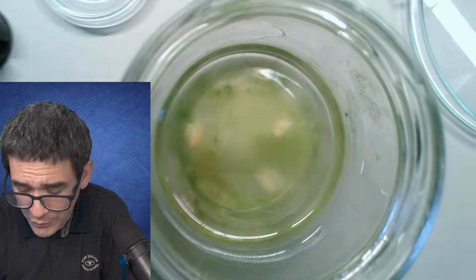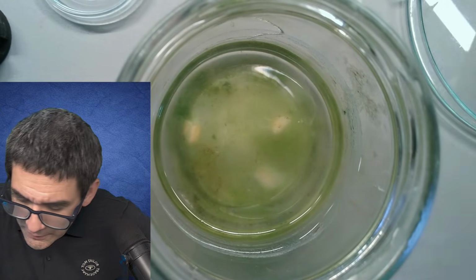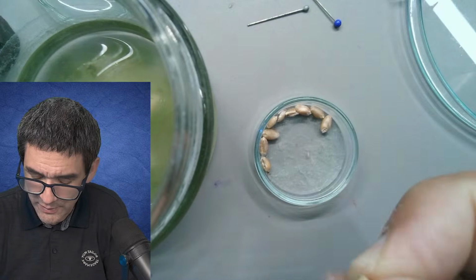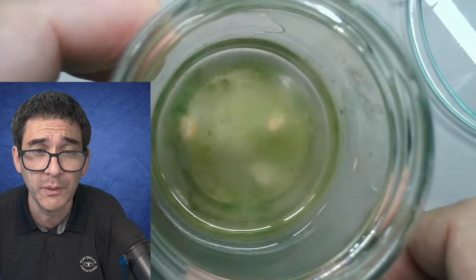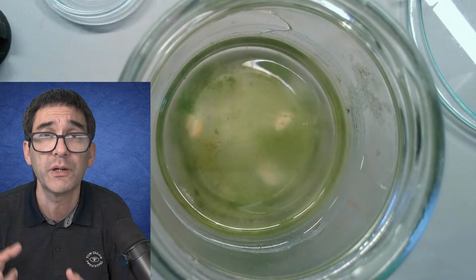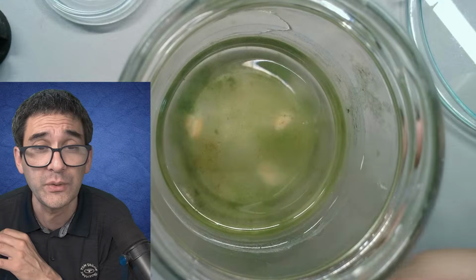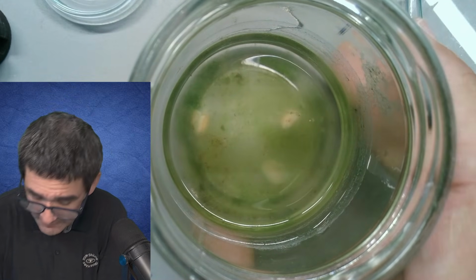For those of you who were not there when I did that, what I have done is I've taken these wheat grains, cereals in other words, I have taken 1 or 2 of them, crushed them between 2 spoons, and simply dropped them into a water sample. What will happen then is that ciliates and flagellates and paramecia and hopefully rotifers will start to grow here. It looks very cloudy. This basically means there are probably also plenty of bacteria present.